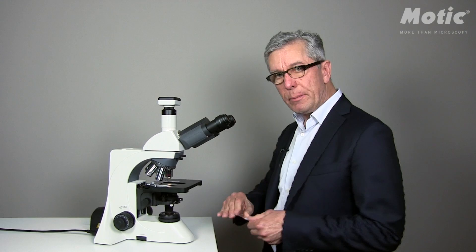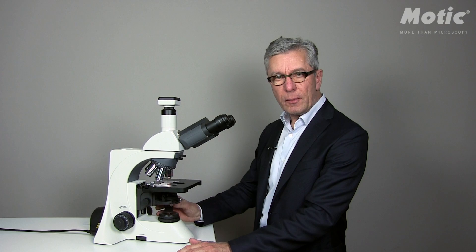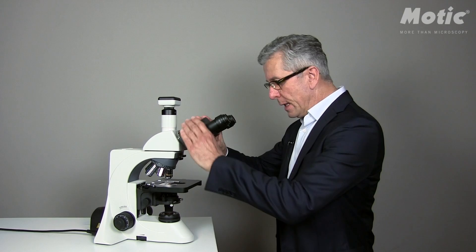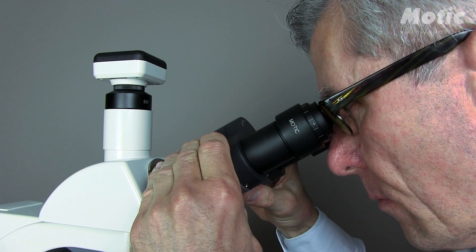So how to do it? First of all, switch on the microscope. The main switch is on the back of the microscope. Take your sample and place it onto the stage. Move the XY stage until the sample is in the ray path. Swing in the 10x objective, which is coated with a yellow color.